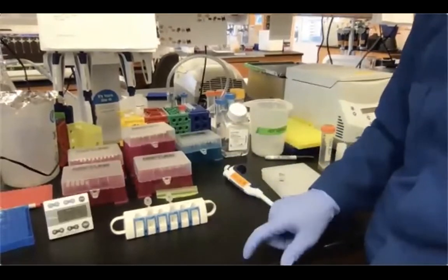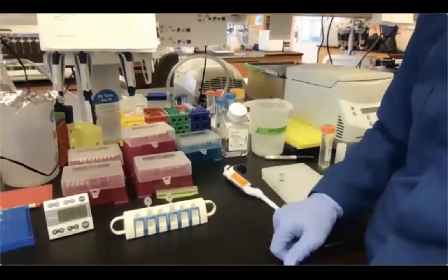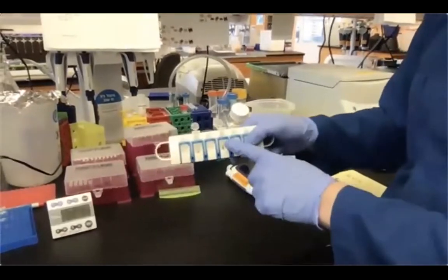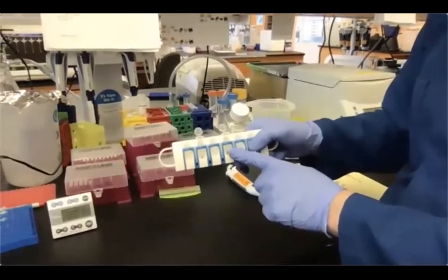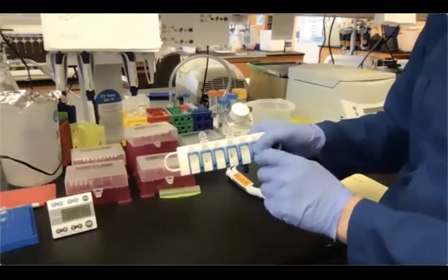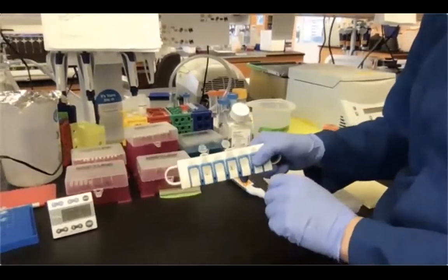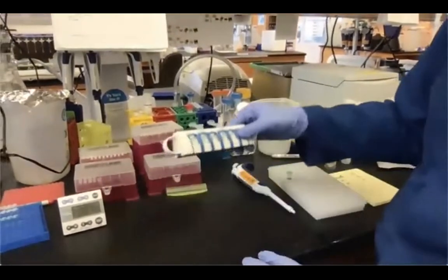The drying time greatly depends on the type of tubes that you have and the amount of beads that you want to dry. So I would suspect that sample number 2 or sample B, which has more beads, will take longer to dry than sample 1. And also, if you were to perform the purification in PCR tubes, usually it's faster than 1.5 ml tubes. Okay, so let's wait 1 more minute.